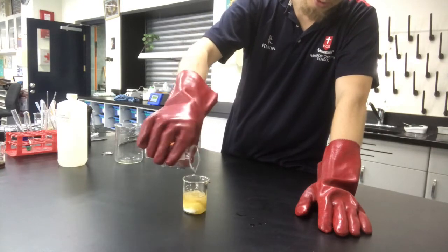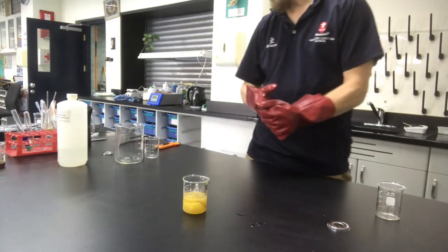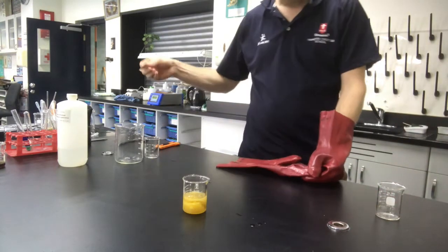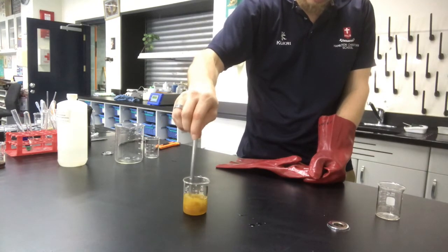It just takes a little bit to get started, so we're just going to have to wait a little bit. Just going to give it a little bit of stir just to make sure that we've got it all happening nicely there.